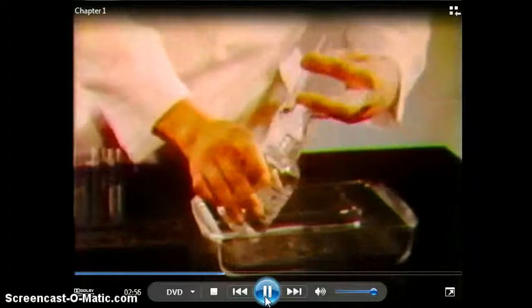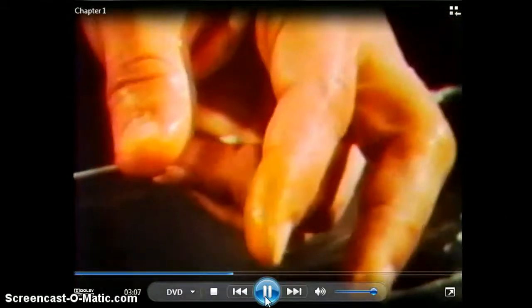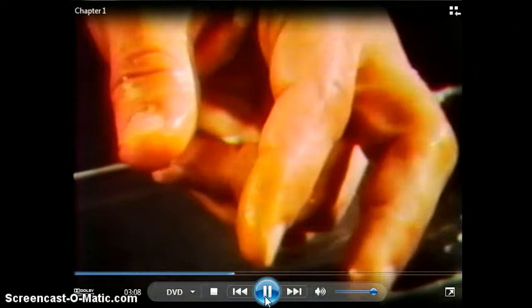Nitric acid reacts rapidly with the skin, leaving a yellowish-colored stain which cannot be removed. The acid should be washed off immediately, or a serious burn will result. This discoloration is gradually worn off when replaced with new skin.